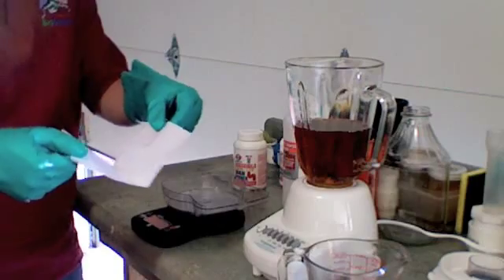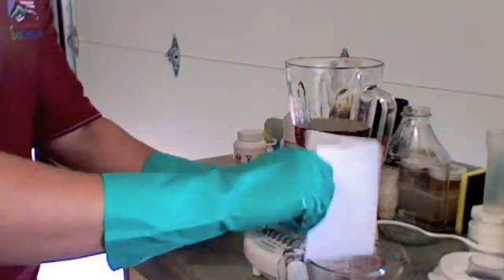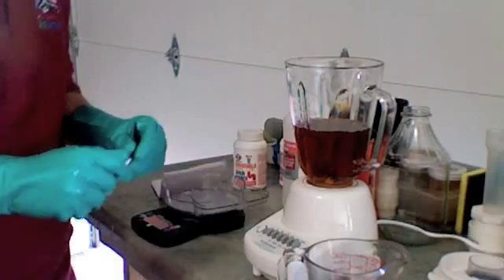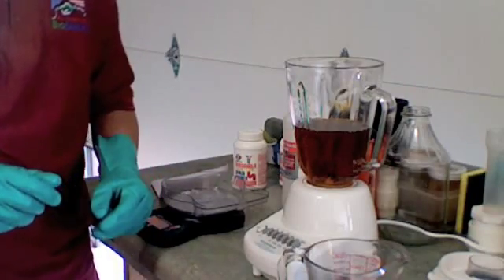Next, we take our catalyst, add it to our methanol. Now we'll take an object and stir it, preferably something wood until all the catalyst is dissolved.